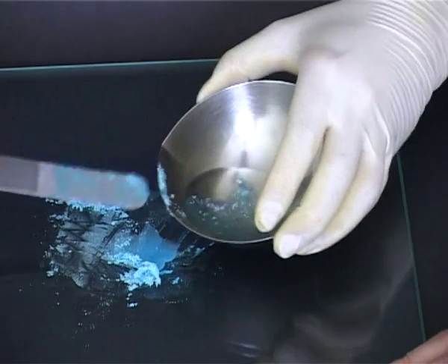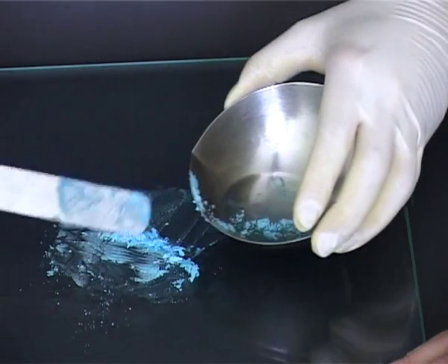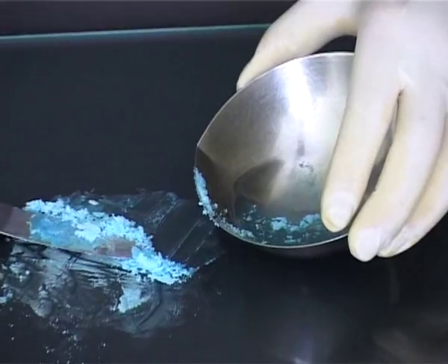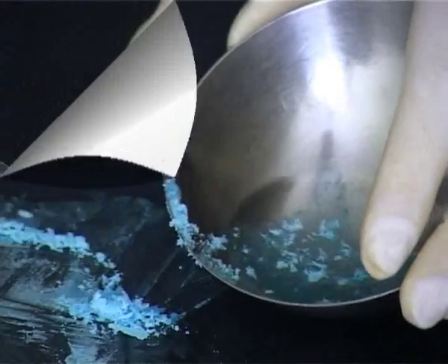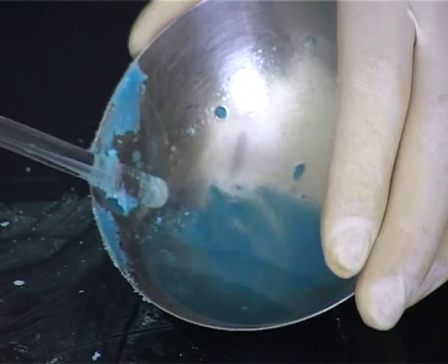Once all the powder has been incorporated into the base, the solidified base is scraped up from the tile and returns to the evaporating basin containing the remaining molten base. Once again stir to help the solid mass remelt.